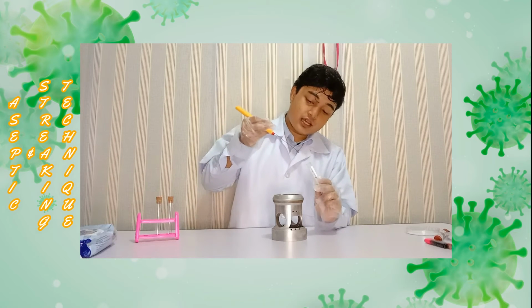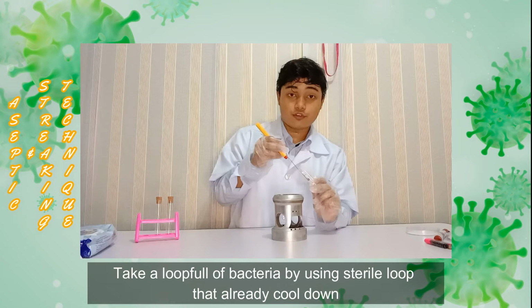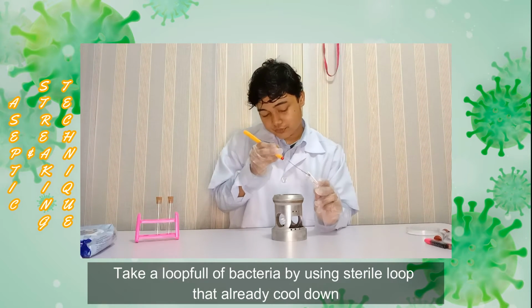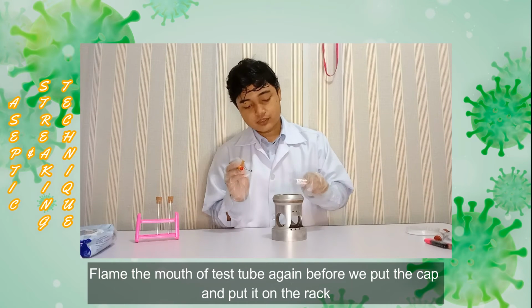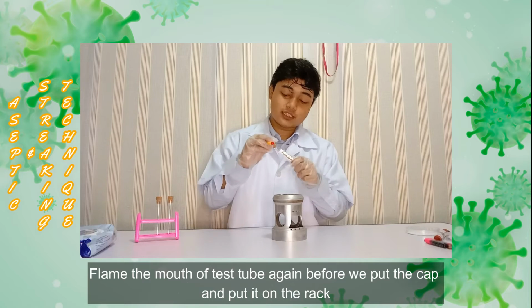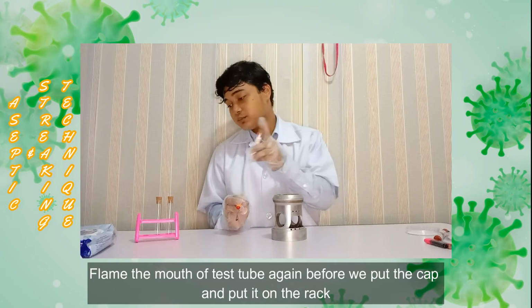Then we put our sterile loop that has already cooled down inside the test tube to take a loopful of microorganisms, and make sure we get a drop of broth. Ready, get. Flame the test tube again on the flame for a few seconds, but not too long, and then we close the cap like this, and make sure to put the test tube back on the rack.